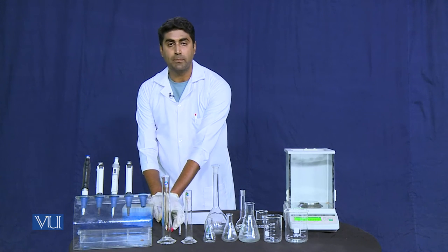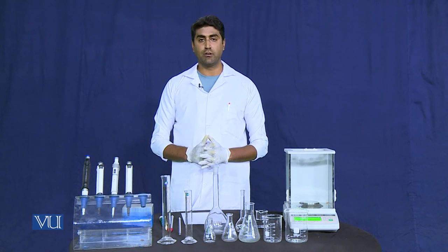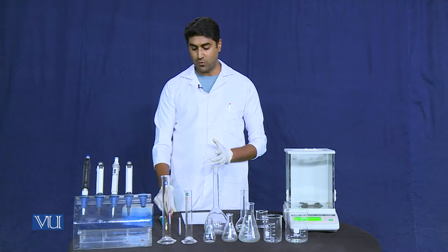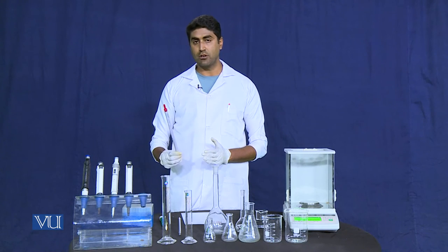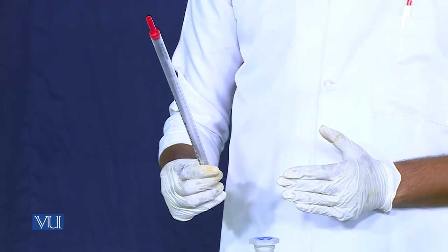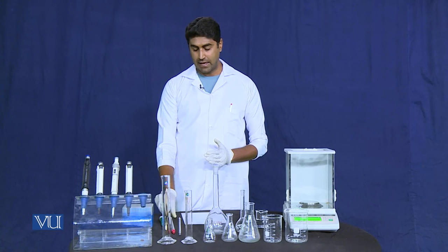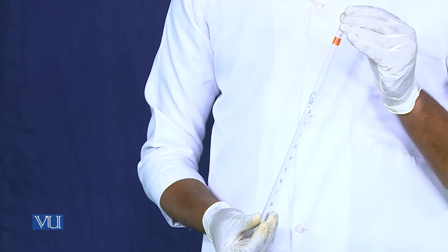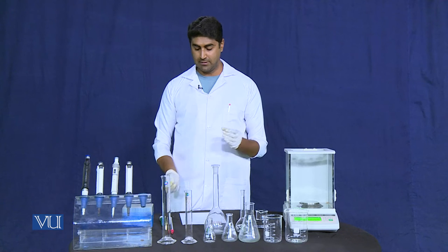Manual pipettes also come in different volume capacities. This one has a capacity of 25 ml, and the next one has a capacity of 10 ml.